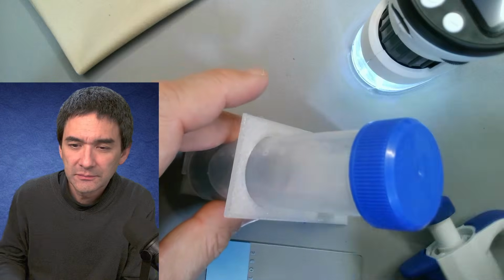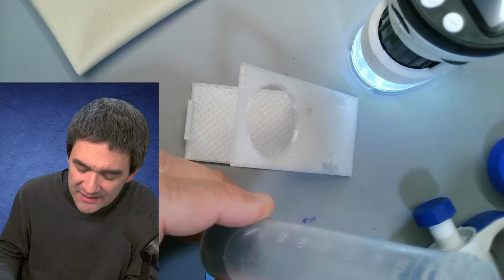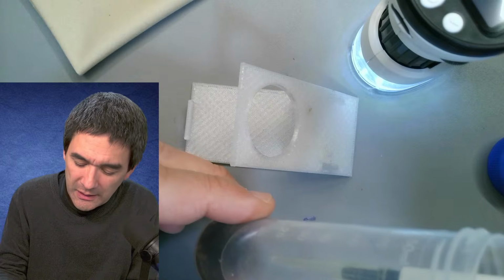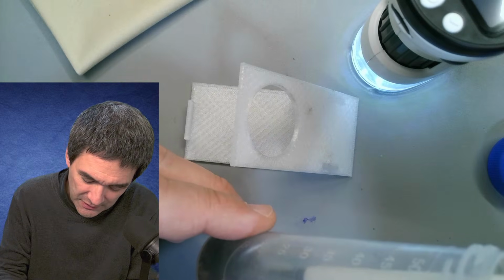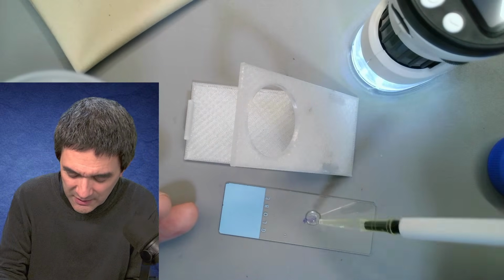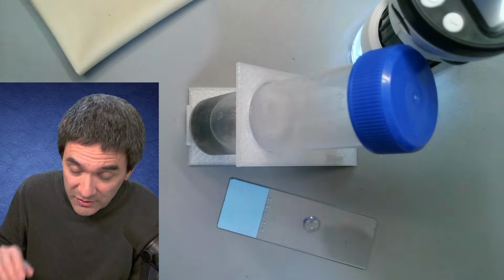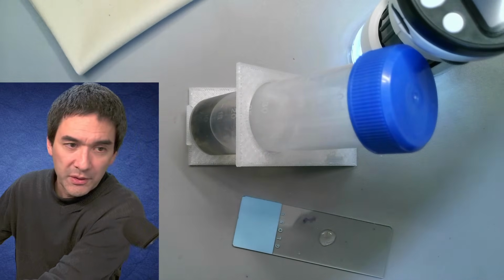So I'm just reading here: labeling the buttons is a whole other level of laziness. Laziness is the correct term to use, because I feel that whoever designed this microscope just didn't bother, you know? I mean, come on, just make sure that the sensor size and the screen size kind of match. It's something I don't fully understand. I think it's to a certain extent a wasted opportunity, which is a pity. And that's maybe the reason they're marketing it to kids, because they think, well, it's only for kids anyway, so they're not going to mind. It's my hypothesis. So let's put those slides away.